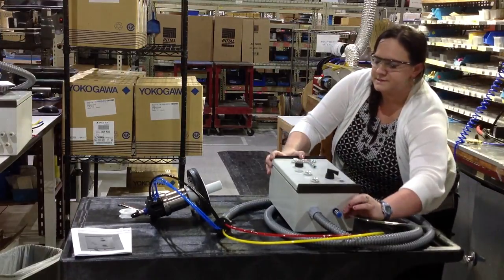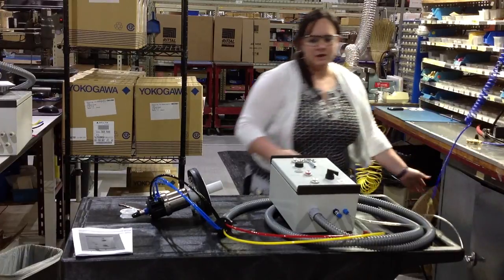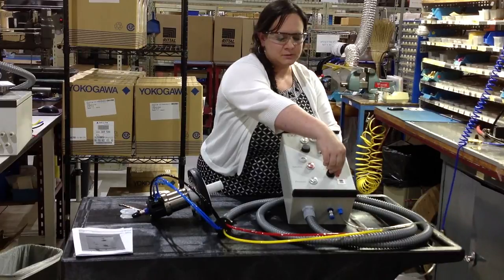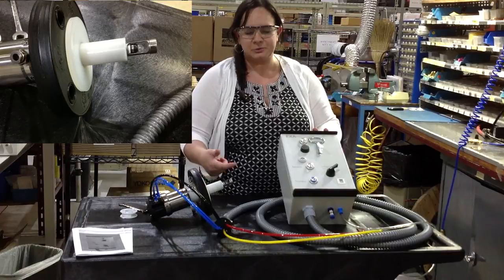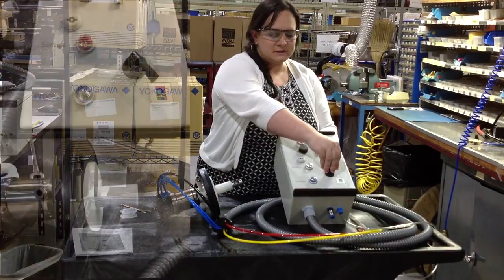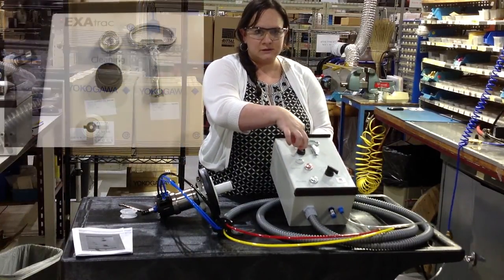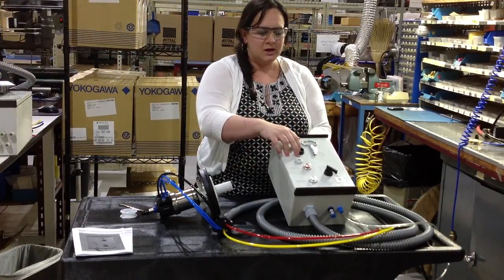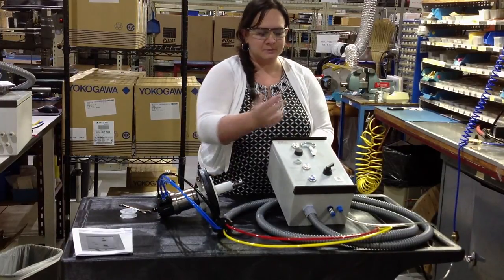Right now it's in service position. We'll turn on the air, and you can see there's a red button that lights up. We'll change the armature since it's manual to process — the blue lights up and it's put into the process. This is how it would normally be installed in your process. You would simply switch it to service and press the cleaning button to control the cleaning. If it had two cleaning solutions, you'd have another set here. Once it's done, you simply take it back and put it into process mode.